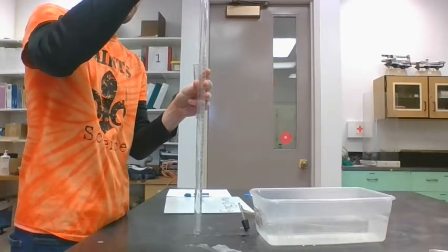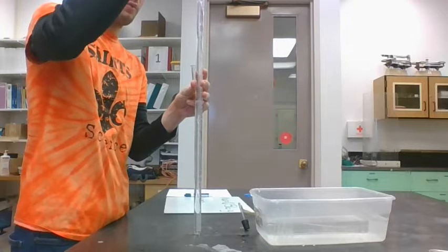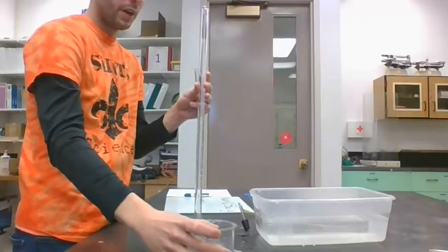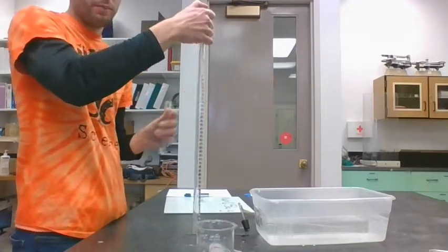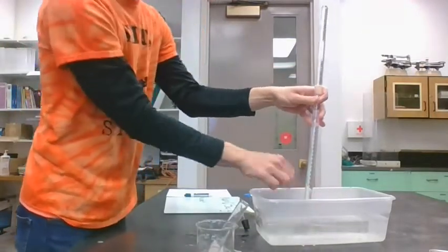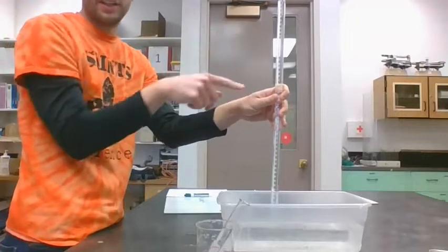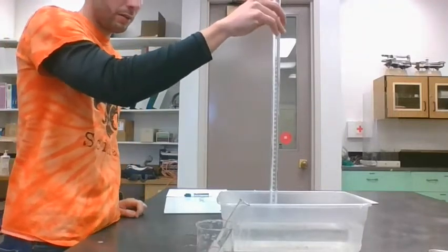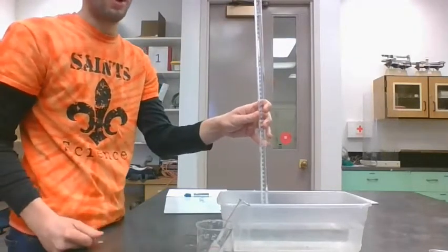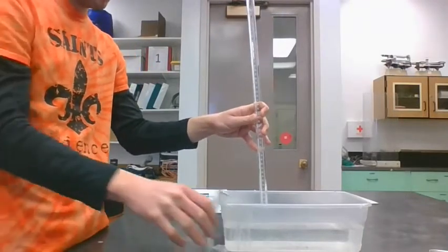So the first thing I do is fill this big tube all the way to the top with water, all the way, so that there are no air bubbles inside. Then I cap it with my thumb and flip it up. If I submerge it in this bucket of water, the water that's in the tube stays in that tube. It will not fall into the water until something happens. Like if I take this out, it's all going to fall out. But at the moment, this thing is completely full of water.